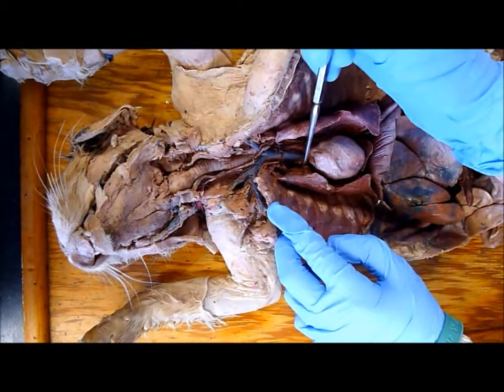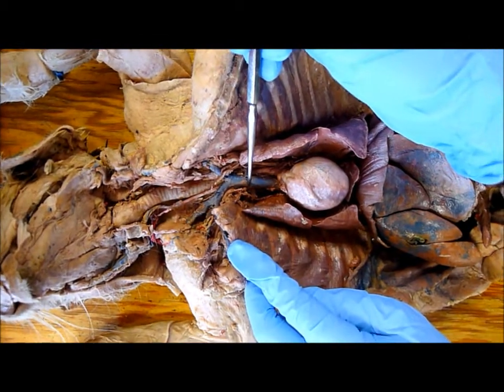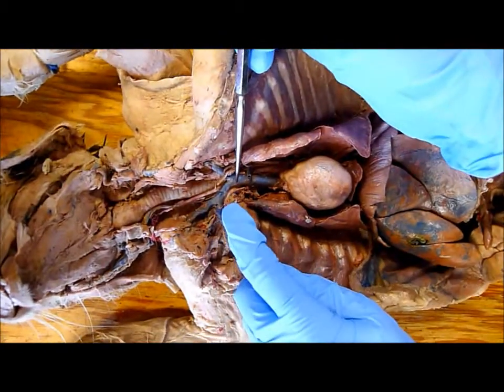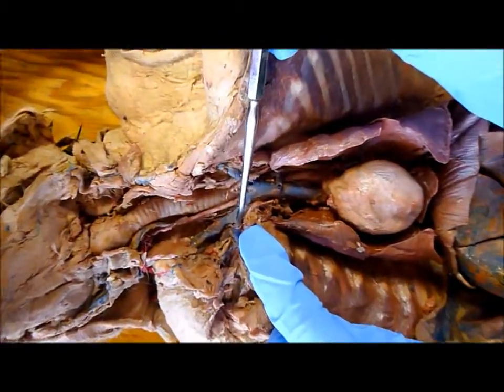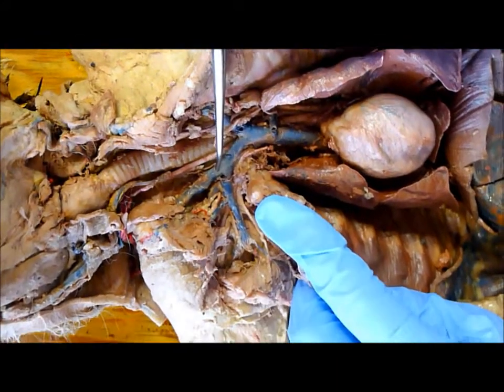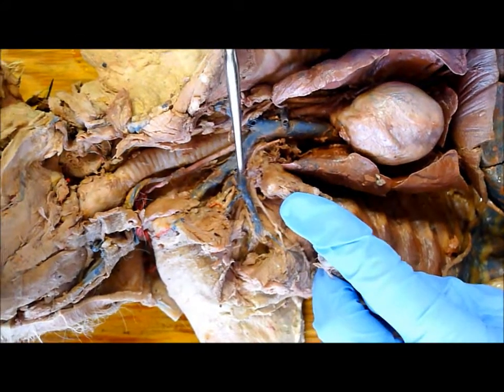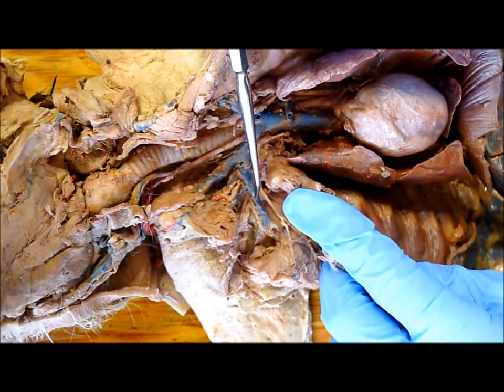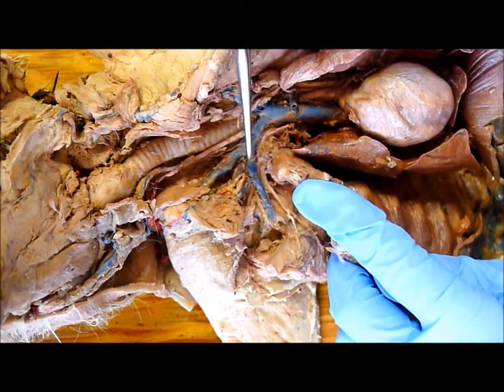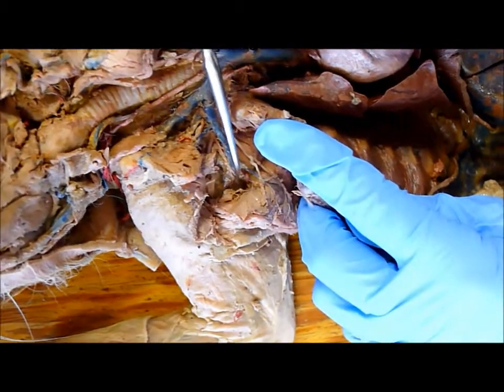The blue one coming out of the top of the heart is the cranial vena cava. It comes up and splits off into two different sides. Right where it reaches the first branch is the subclavian vein. The one that goes down is the axillary vein at the top, and then when it gets a little farther it becomes the brachial vein.